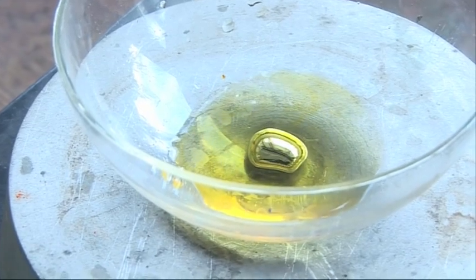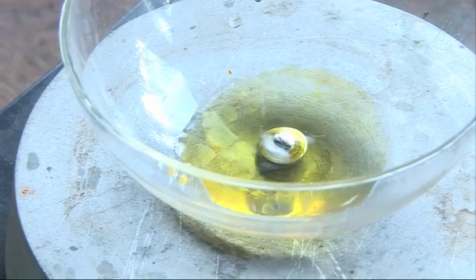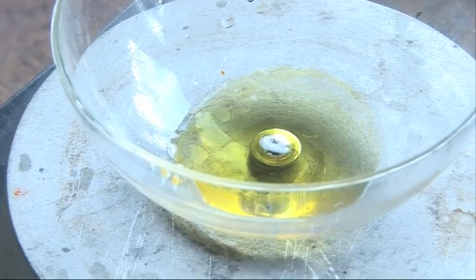So what we're doing in this experiment is we're changing the surface tension of the gallium. So these are the forces that hold the liquid into either a ball, or allow it to wet and flatten on the surface. So when the gallium is naked, it's actually quite flat and it wets the surface. But when we put it under sulfuric acid, we form gallium sulfate on the surface. This increases the surface tension and then pulls the gallium so it's in a nice proud ball.